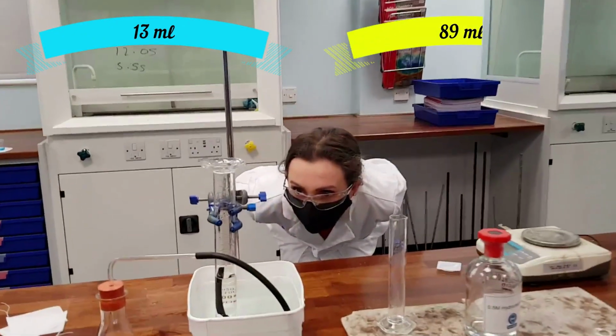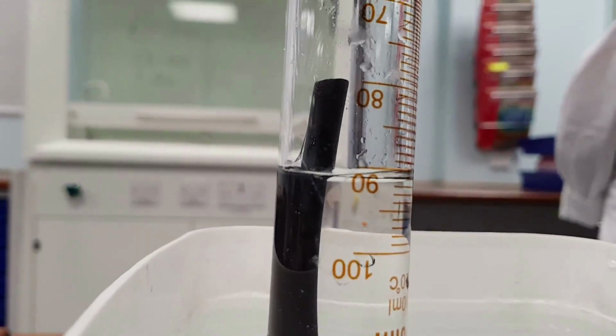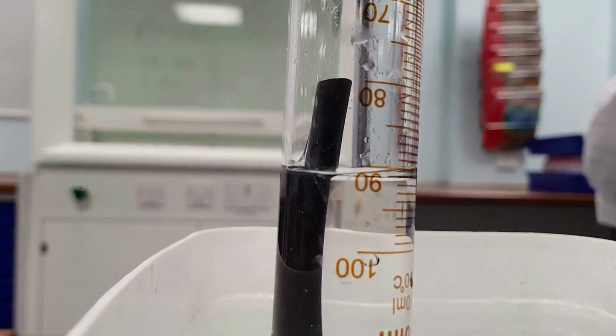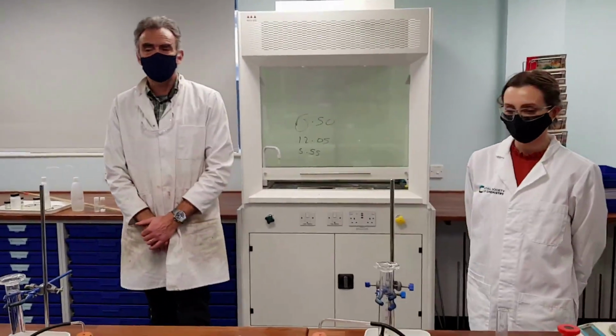I got 89. And just to show you what this looks like, you can see there 89, actually about 90 millilitres of gas on that tube, compared to how many the first time around, Mr. Reeves? 78. 78.